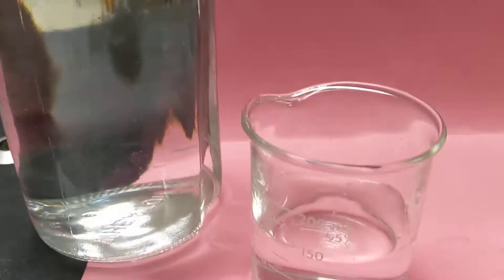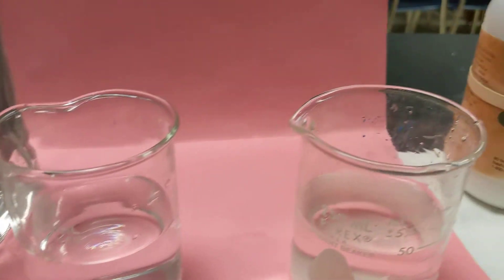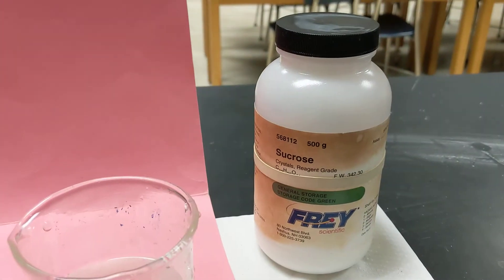Over here I have some DI water and a beaker, and in this beaker I have sucrose, so it's a solution of sugar in water.